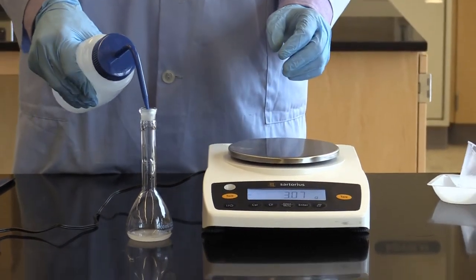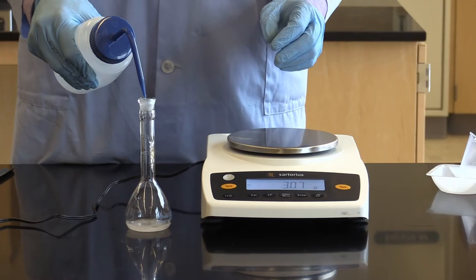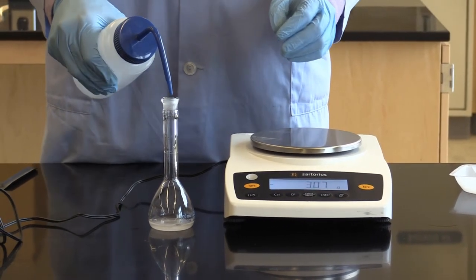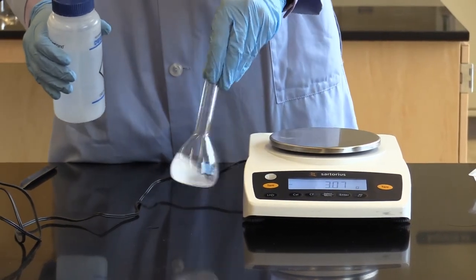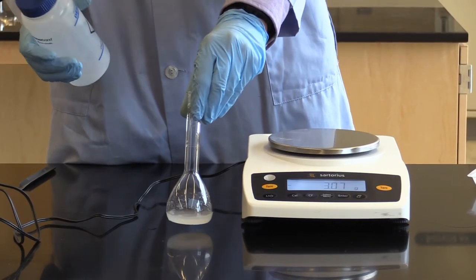And then next I will slowly add water to it. Here I'm using deionized water to get it into solution. So I'll add some water and mix.